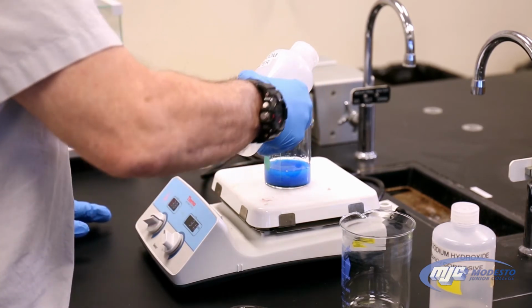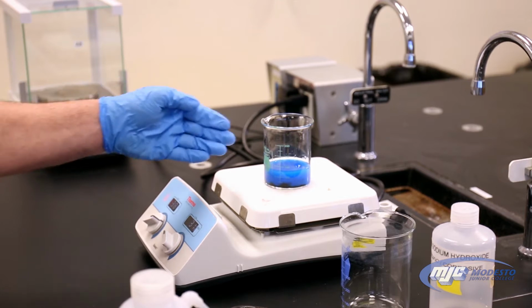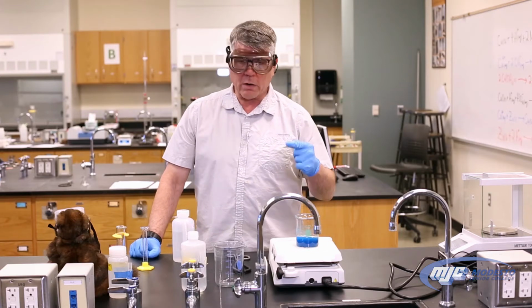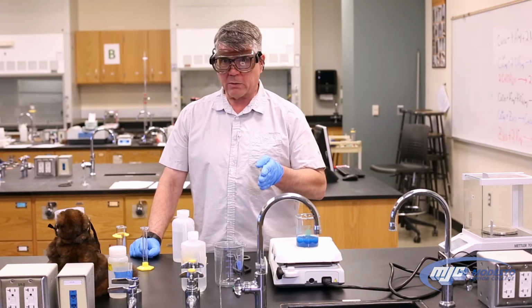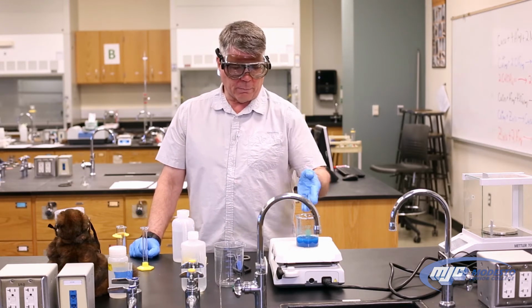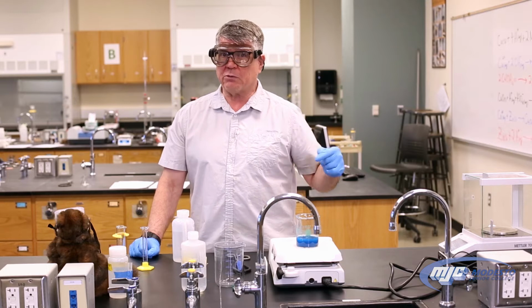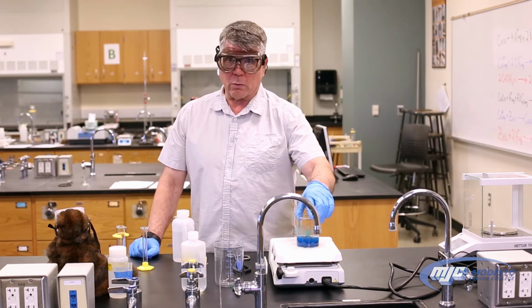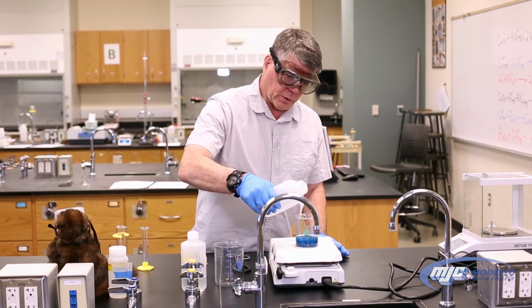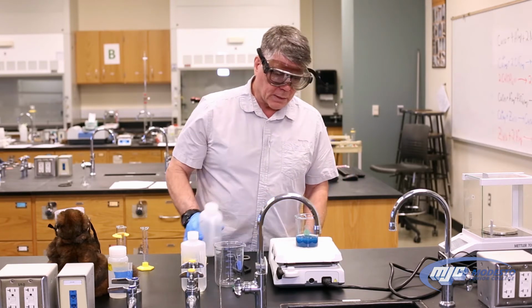One of the things that you learn in this experiment is that transferring, see that bumping right there? Got to be careful about that. Whenever you transfer something from one container to the other, and we do that a lot in this experiment, you lose some of the material that you're transferring. Our goal in this experiment is to transfer every single atom of copper that we started with until we get to the very end. That's our goal. All we can do is the best that we can, and some of the tricks are to make sure that when you transfer something, you rinse it well so that as much as you can gets transferred over.